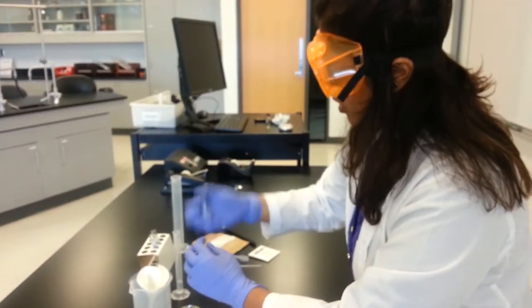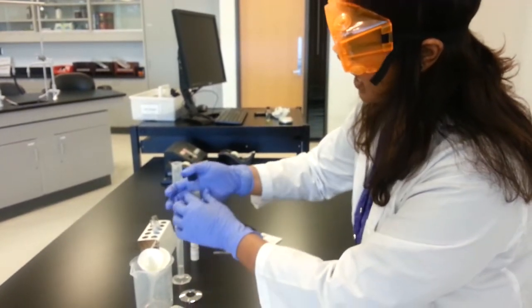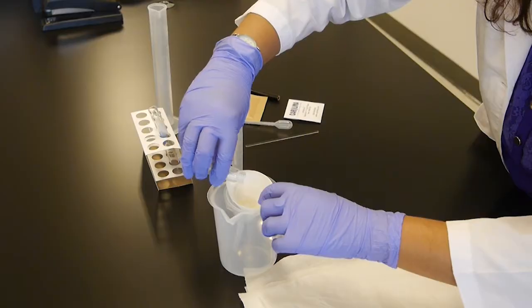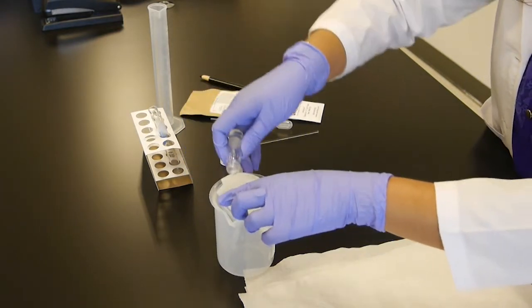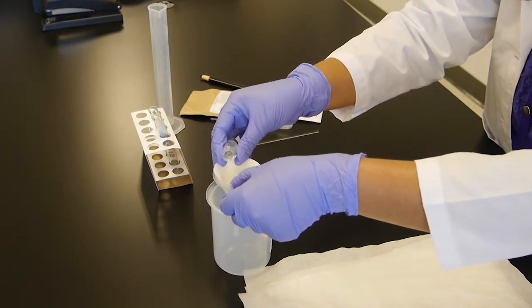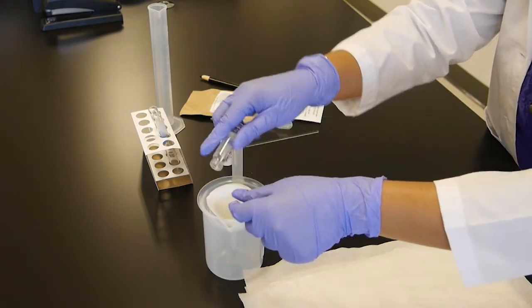This is called salting out. So the sodium chloride is supposed to salt out the soap from the fatty acid mixture. Let's see. Let's pour it down again here. It's supposed to be soap. That's it. Filter out. So the residue you will get on the filter paper, that's the soap.